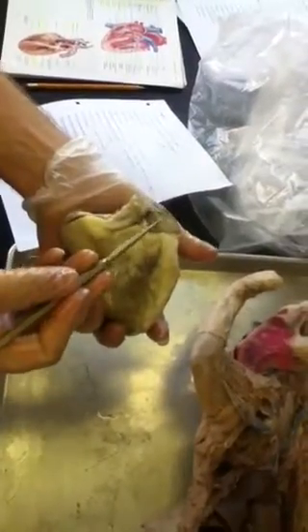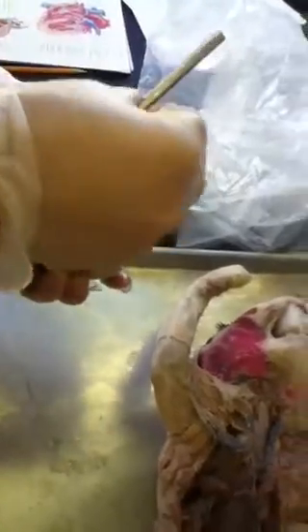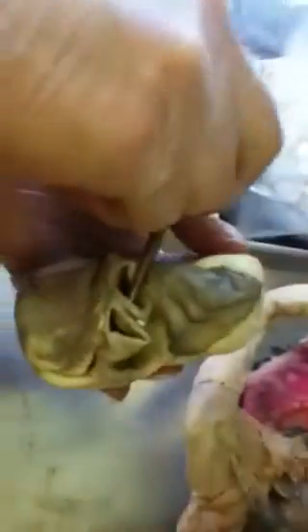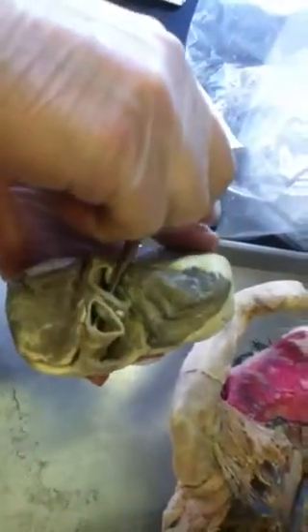So first we'll start with the first one on the top. That will be the pulmonary trunk, which is the first hole on the anterior part. Pulmonary trunk. Okay. Right posterior to the pulmonary trunk, there's the aorta. Okay. And right on top of the aorta, there's the brachiocephalic trunk artery.